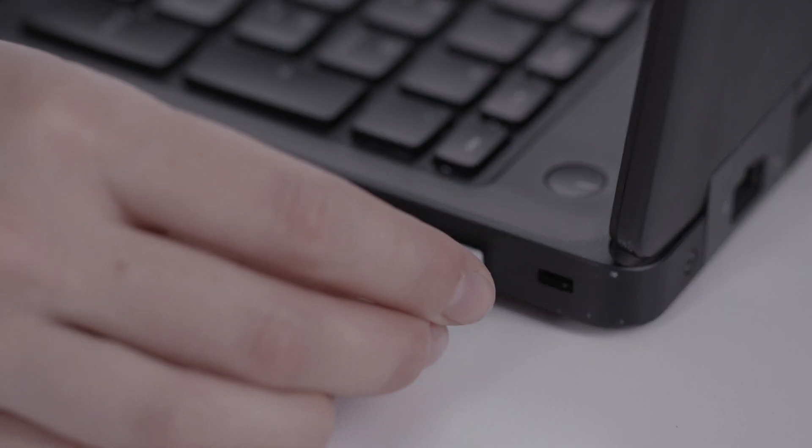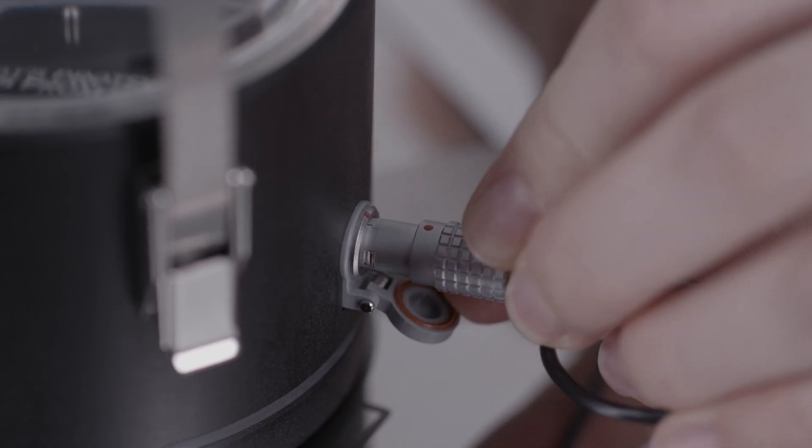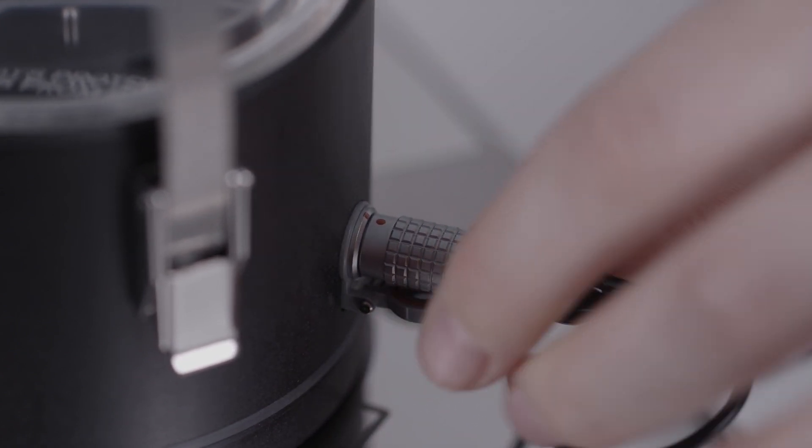Connect the sensor unit to the computer via the USB adapter. This enables you to monitor the pressure increase when screwing in the tensio shafts to prevent damage to the pressure sensors.